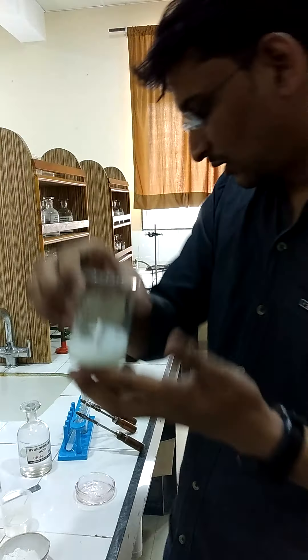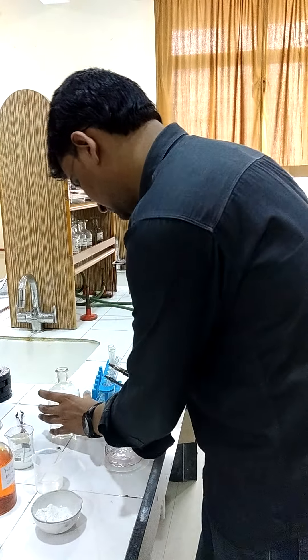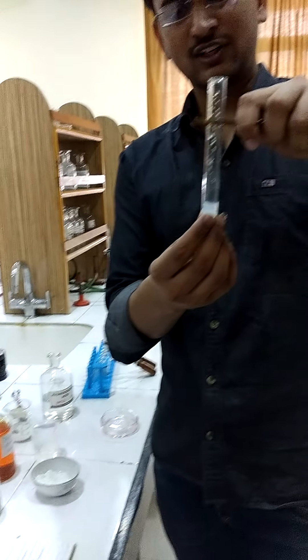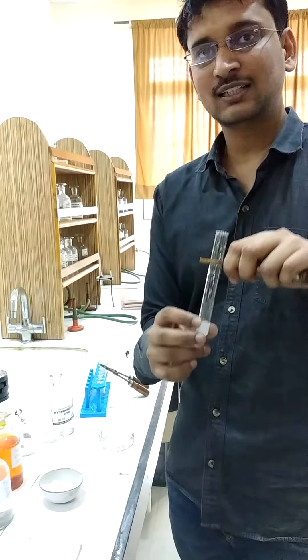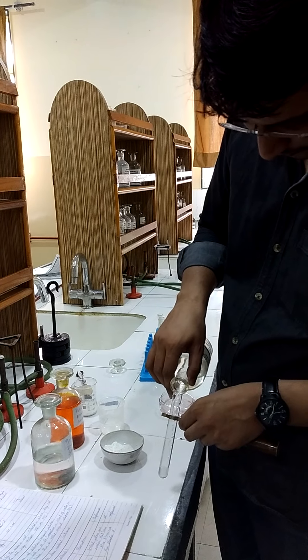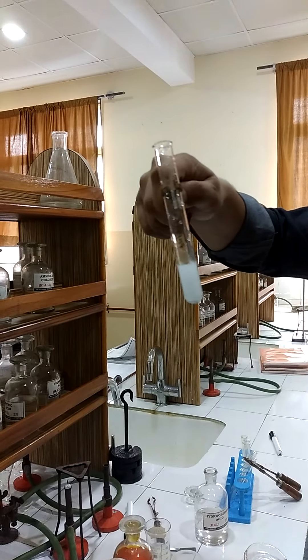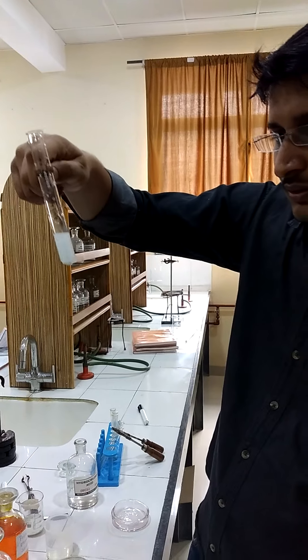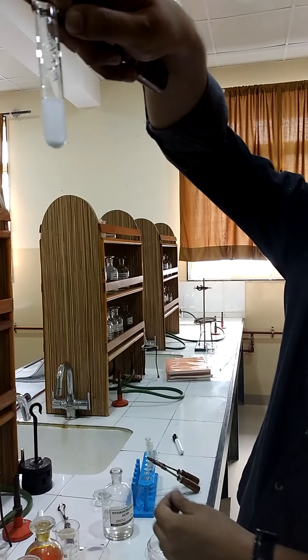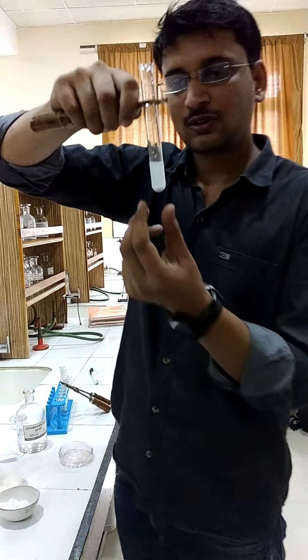Here also you can see that this is not totally dissolved. Now we are going to take HCl. As we have already prepared the OS, if we add HCl and we get a white precipitate, that means group 1 is present. The white precipitate we are getting at the bottom — it is clearly visible, so group 1 is present.